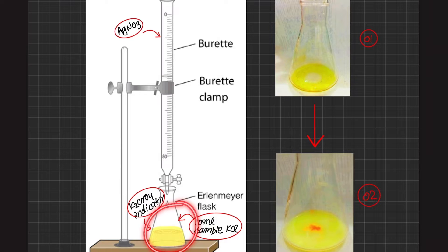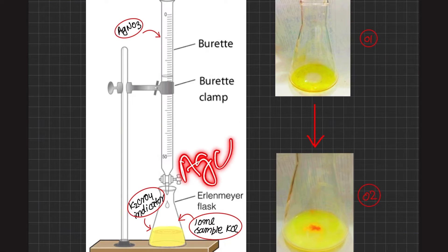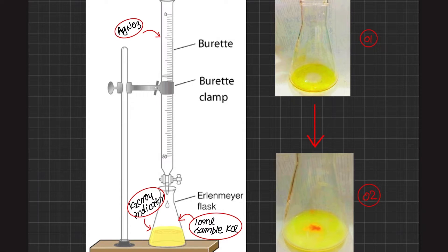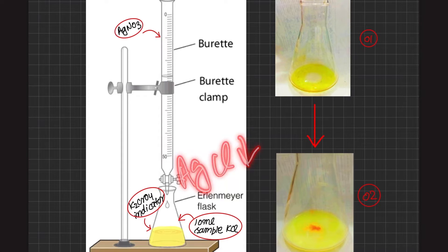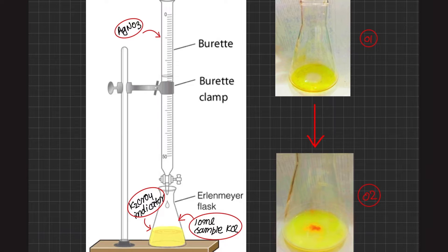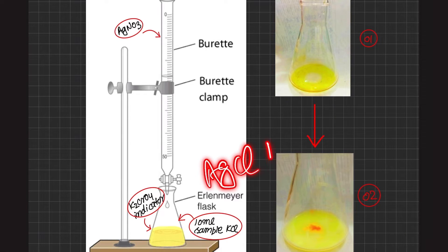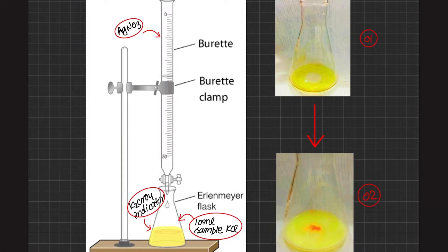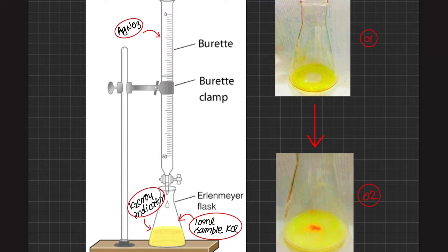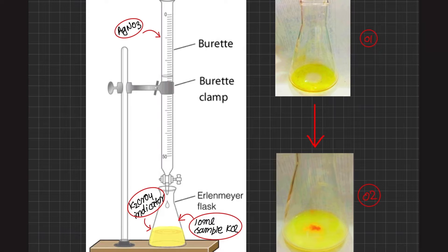One question arises: if silver chloride precipitates are formed in the flask, why do we need to add K₂CrO₄ as indicator? We could stop the titration when there is no further silver chloride precipitation. However, without the indicator, the silver chloride precipitates are white and very cloudy, making it difficult to determine exactly where the reaction has stopped. So we add potassium chromate as indicator to provide a clear endpoint signal.